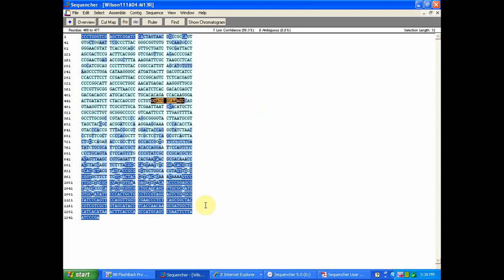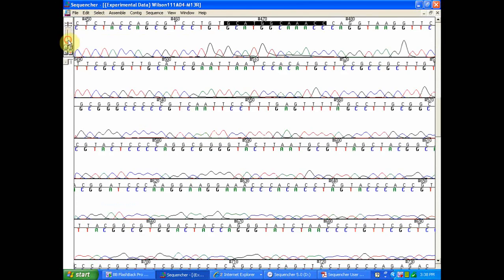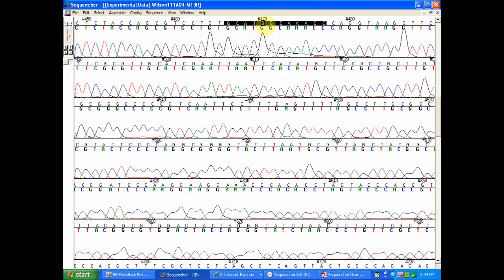As we can see within this sequence, we have some good quality data with about 7 low quality base calls within it. I'm going to go ahead and highlight the region, open that chromatogram, and we'll amplify this length of nucleotides to get a better idea of what's going on here. As we can see, we have a very large G peak, which resulted in an erroneous call to the next 5' position. This is a very clear T peak.